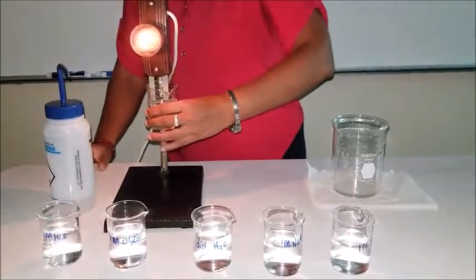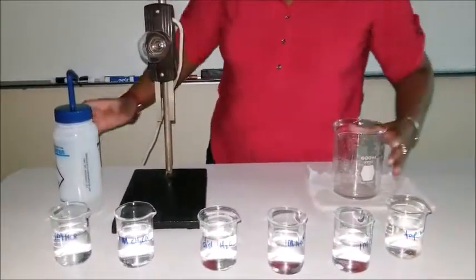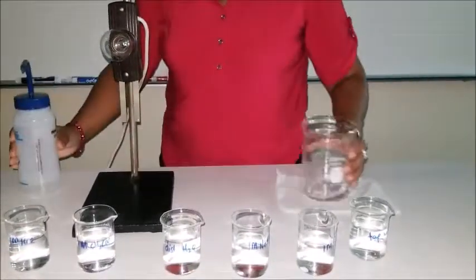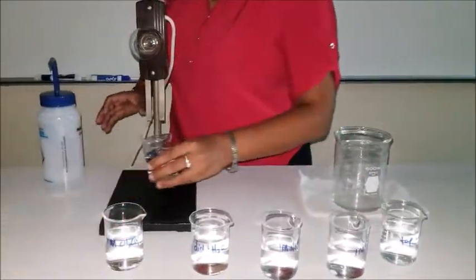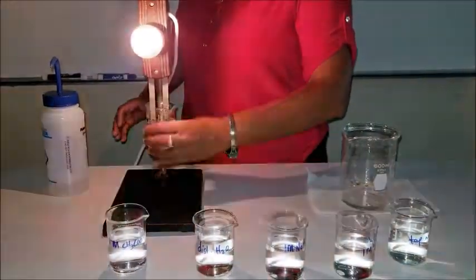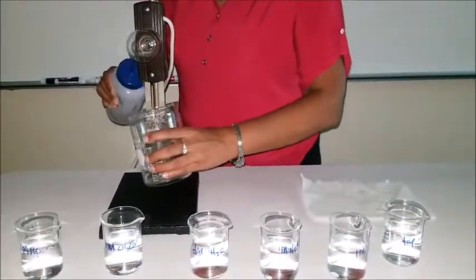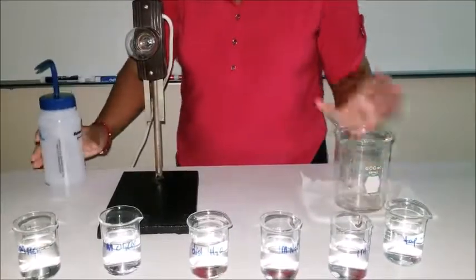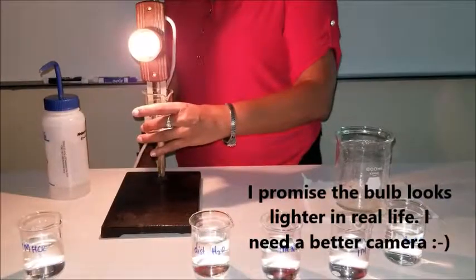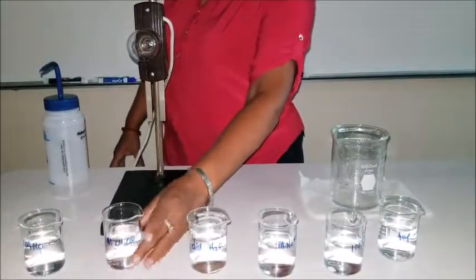In case you want to see this again, let me do this quickly once more. We have HCl. Yeah, after tap water, that is pretty something. And then acetic acid. I hope you got your comparison, because I'll stop there. The rest of them were pretty okay.